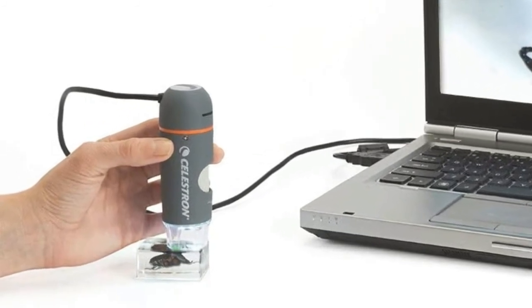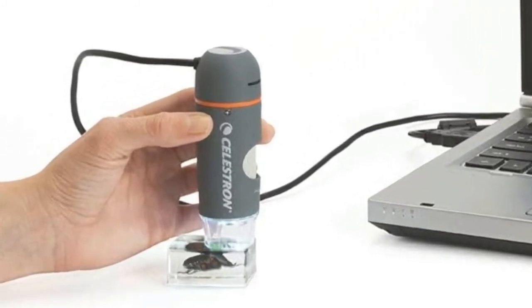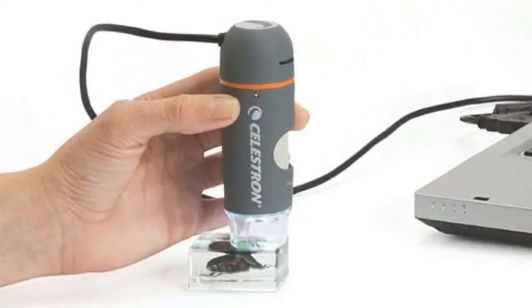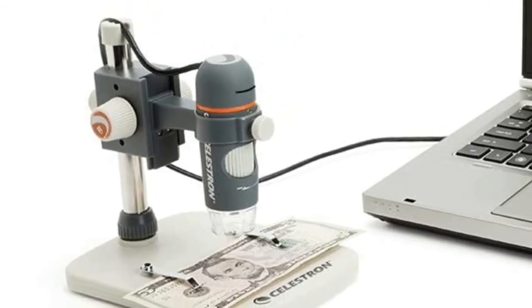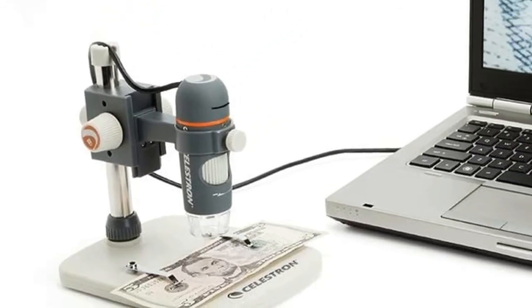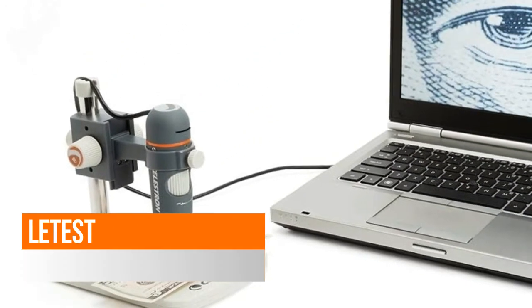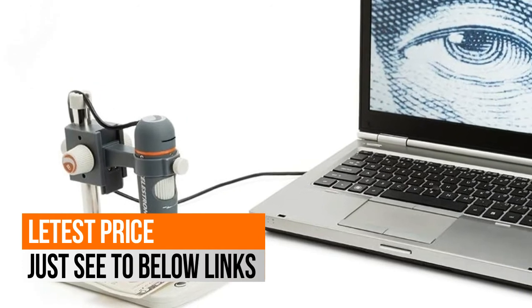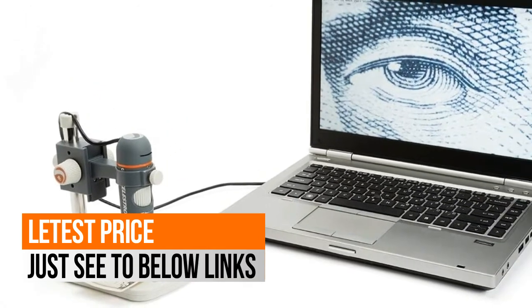4-foot USB 2.0 cable for easy maneuverability when viewing large surfaces. Intuitive software with measuring features. Windows and Mac compatible software and firmware.